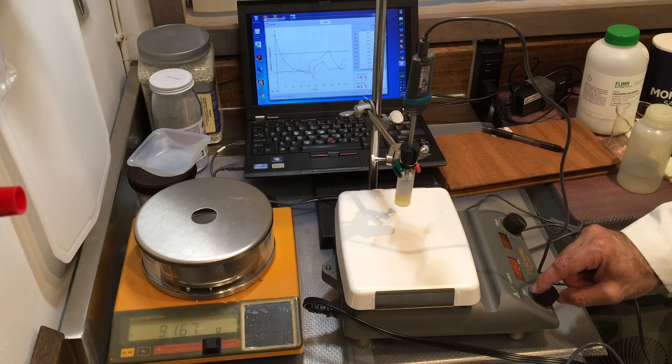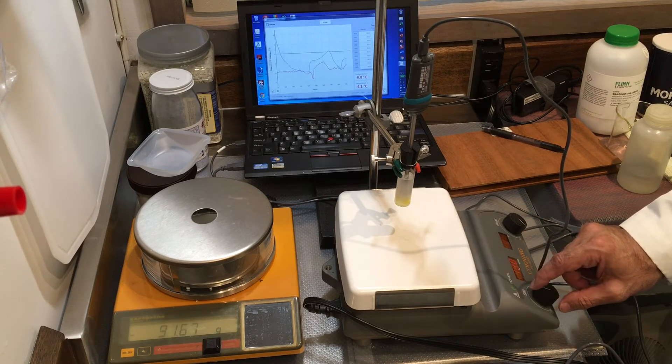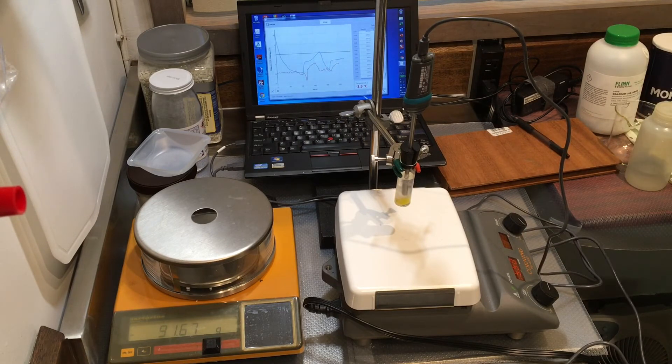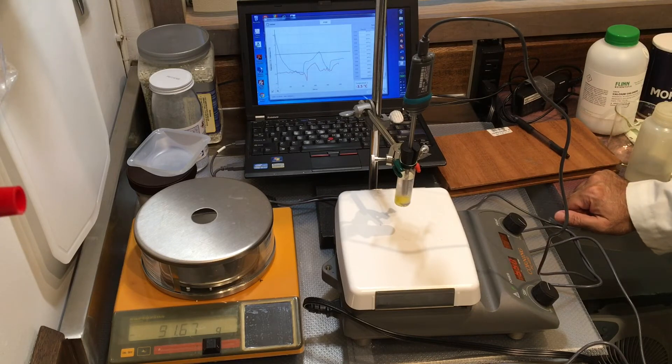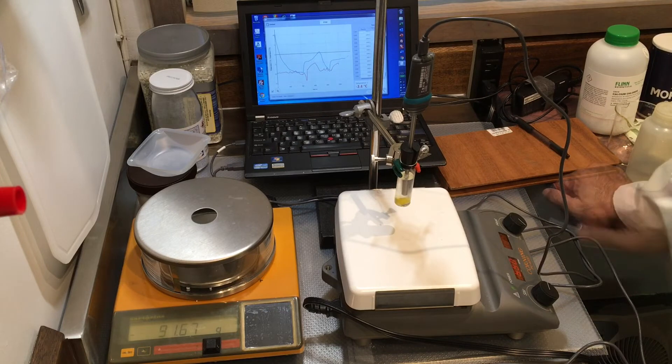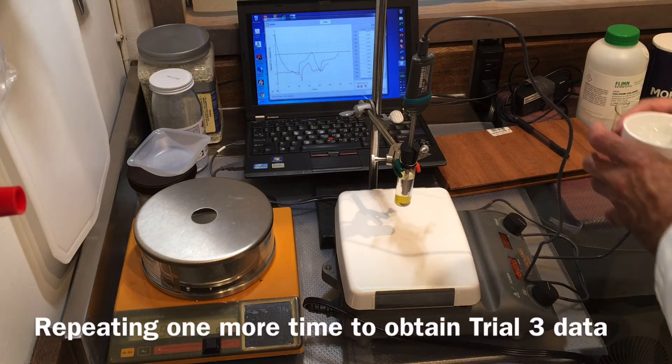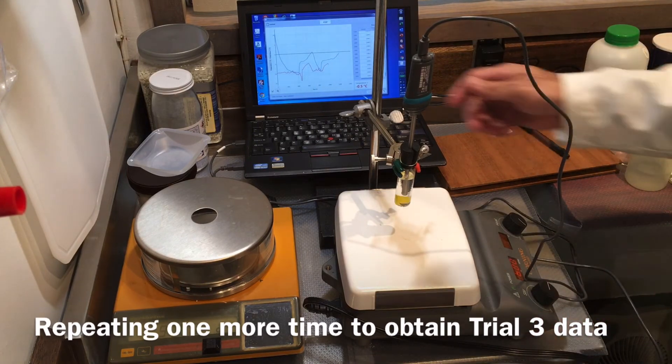I'll try to remove the... it's trying to move, but it has a hard time, but let's see. It's dropping a tiny bit down. That's good, still melting. I'm getting this as a way of mixing, so let's go ahead and start to cool it down again.